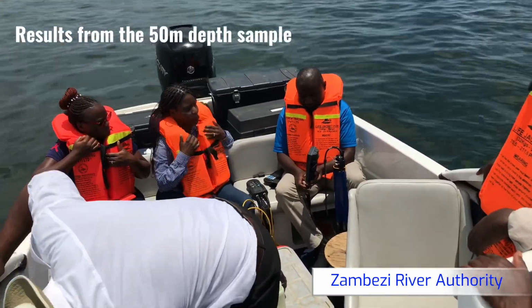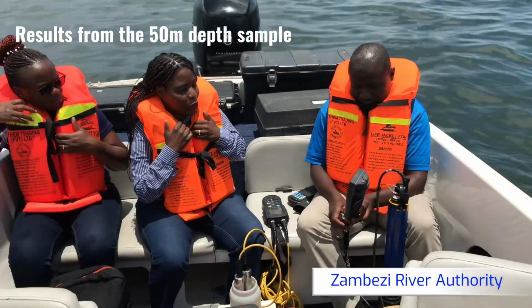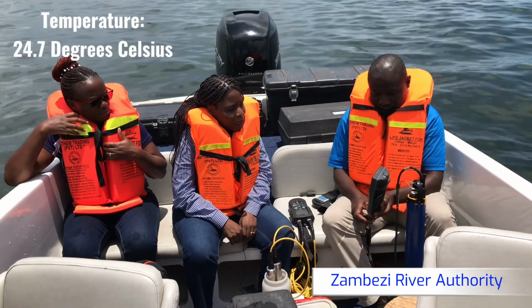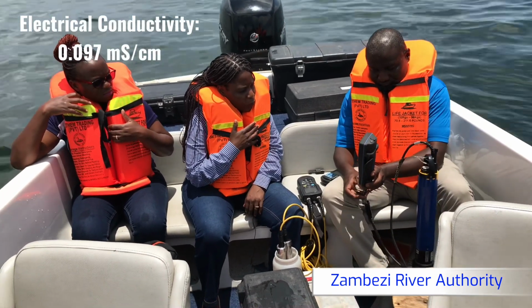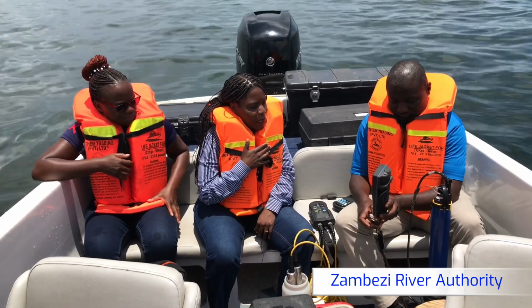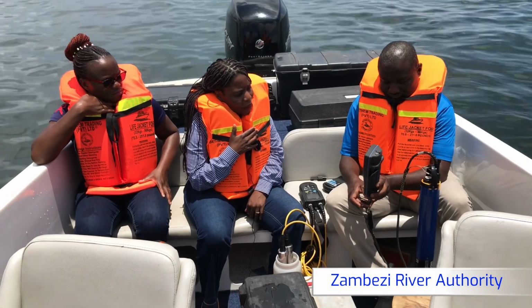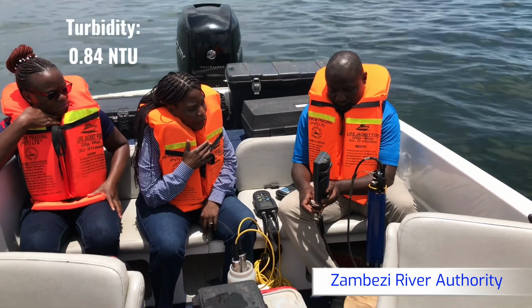With the multi-parameter, we are ready to read the results of the sample that we just collected. I'm sure you are following. The temperature at depth 50 meters was 24.7. Then the electrical conductivity was 0.097 millisiemens per centimeter. Then the total dissolved solids was 63.16 milligram per liter. Then the turbidity at that depth was 0.84 NTU.